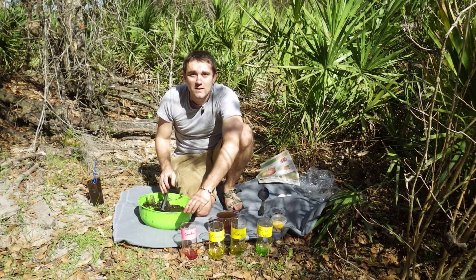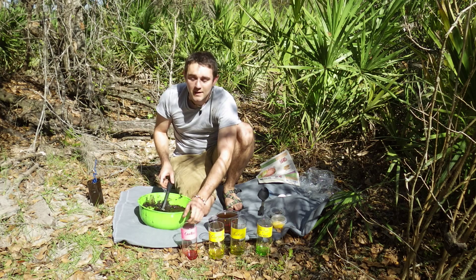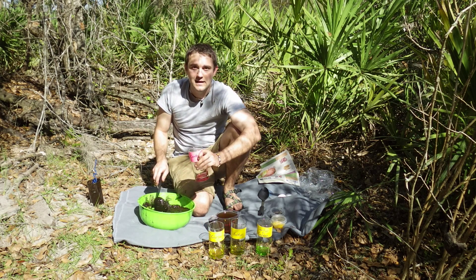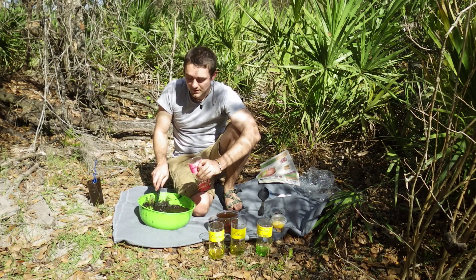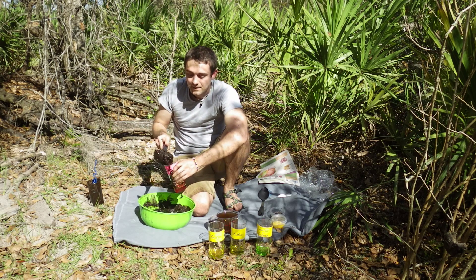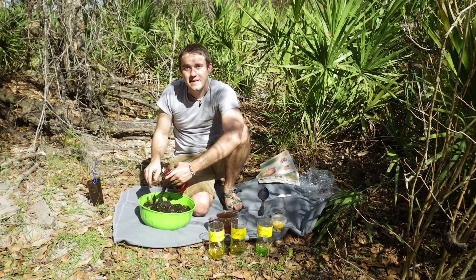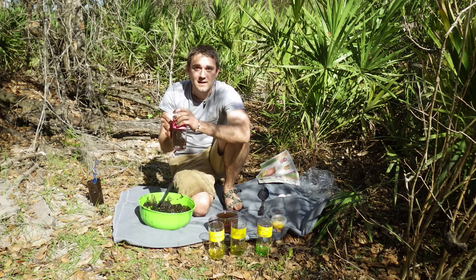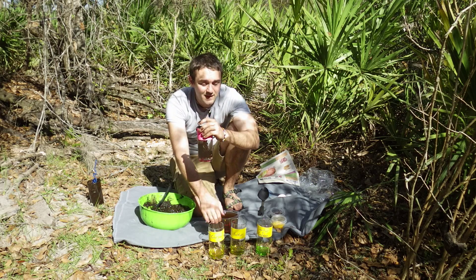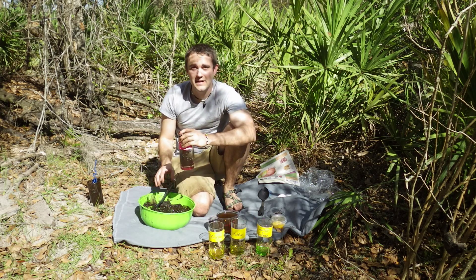The first one is the control. The control simply has the mud and that is all — nothing else is added to it. The control is made in order to see if anything grows in the control glass without adding any of the additional ingredients.